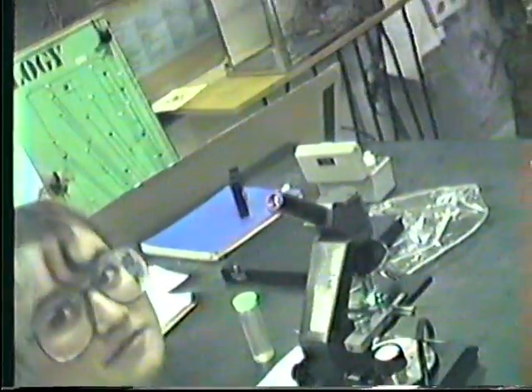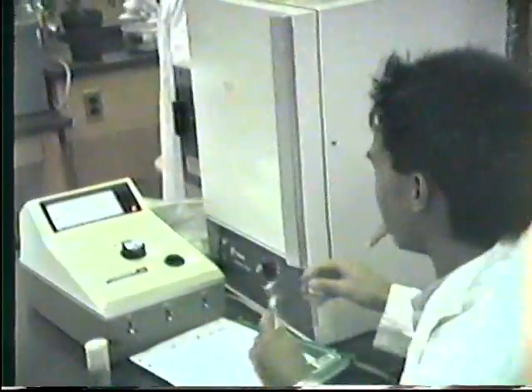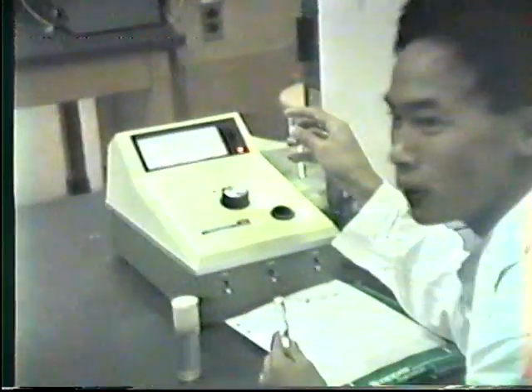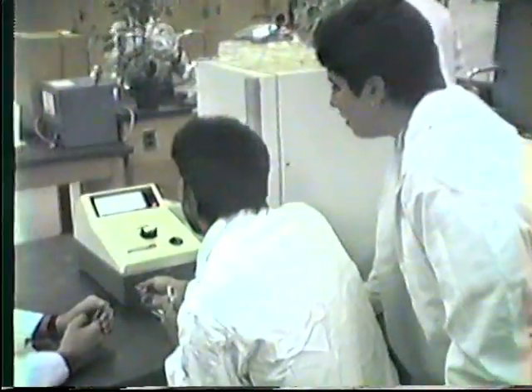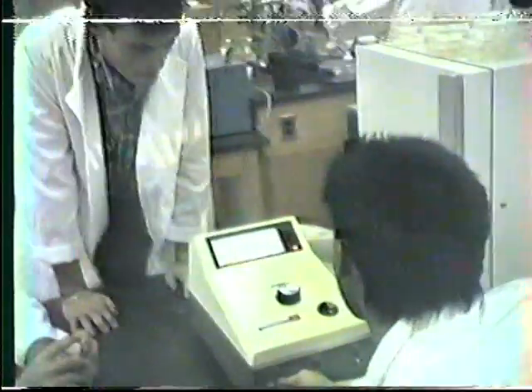Part of the problem having your white gowns is causing a reflection. The shadow. Well, you got white underneath anyway, so no. I can put my sweatshirt on. It's great. Okay, can you? This is lake water. Is that tap water? This is the tap water. You don't talk. Is that the tap water?